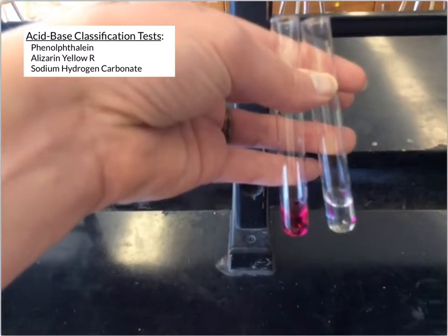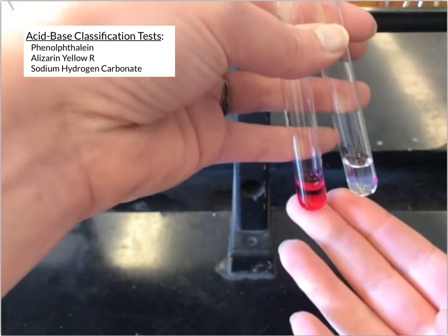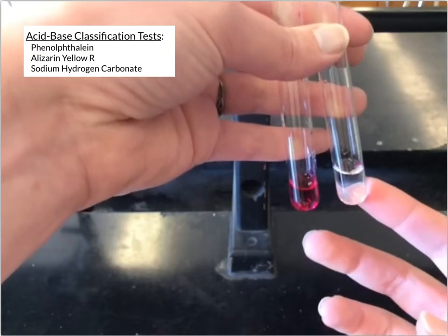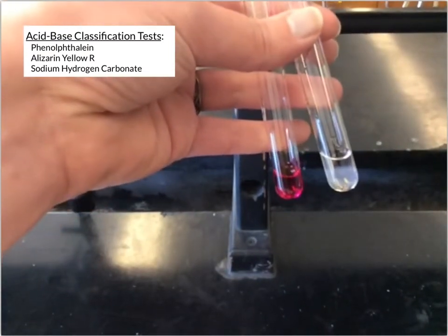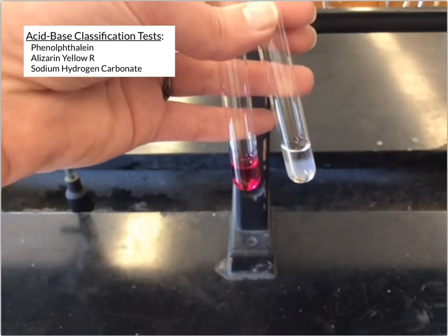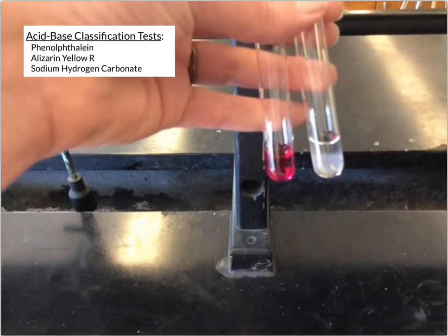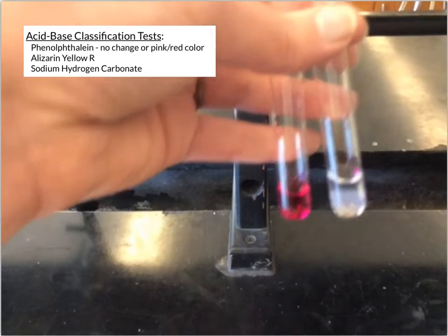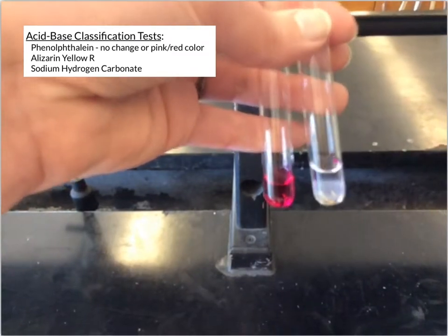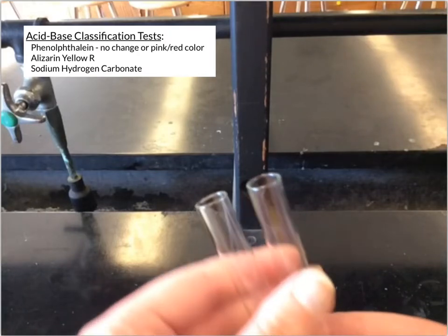Okay, and you should be able to see right away that the one on the left is really a bright pink, and then the one on the right didn't really change. It's clear. It's maybe a little bit cloudy in there, but in general you don't see any kind of change to that. And so that's your 2 kind of observations for phenolphthalein. Either there's not a color change, or you'll see a pink color from a substance.